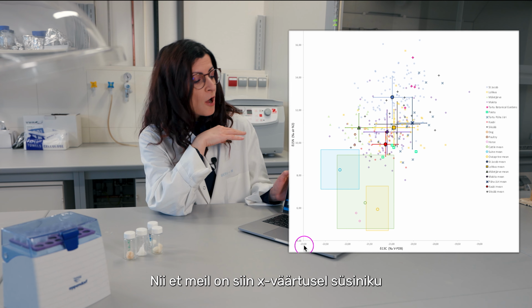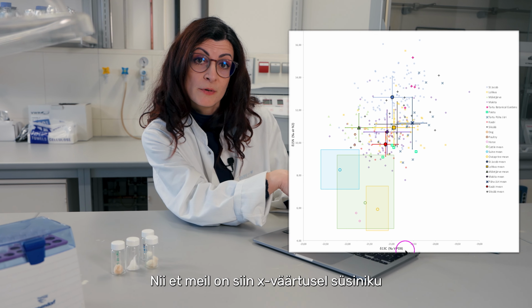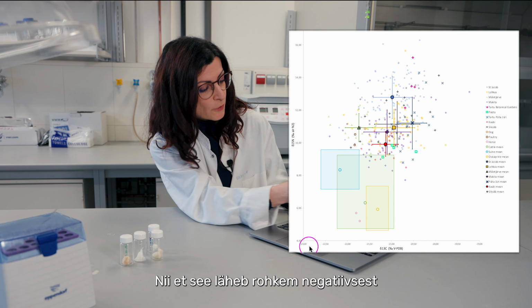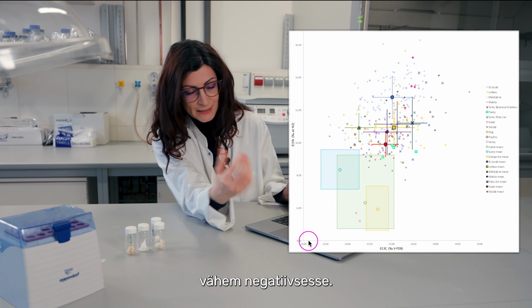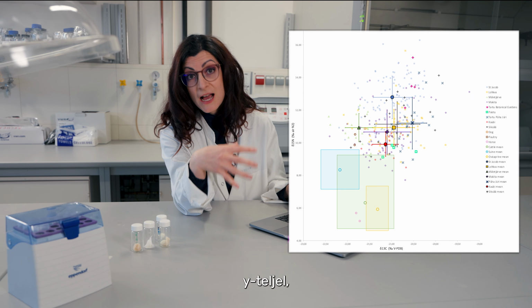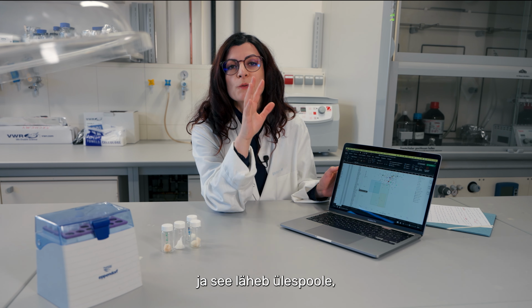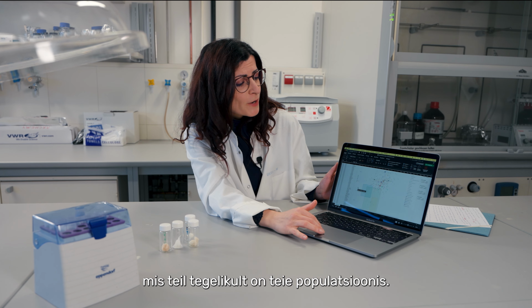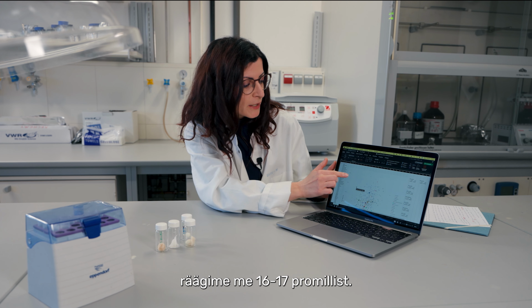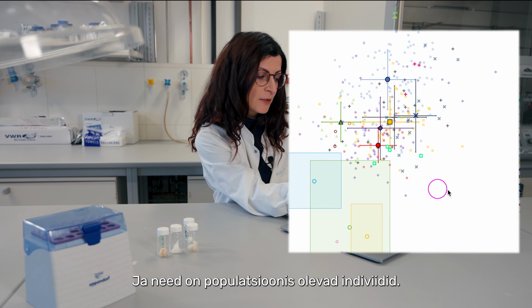So on the X axis over here, we have the carbon, and it's all negative, so it goes from the more negative to the less negative. And then on the other side, on the Y axis, we have the nitrogen, which goes from more or less 4 per mil, and it goes up according to what you have in your population. In this case, we are talking about 16, 17 per mil. And these are the individuals in the population.